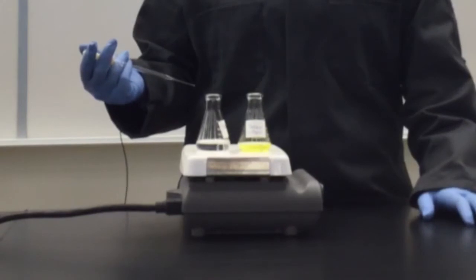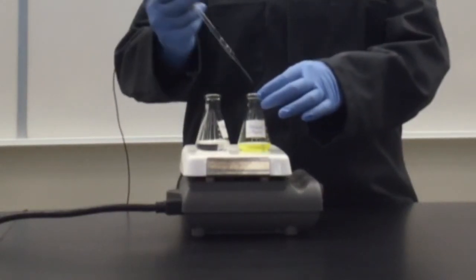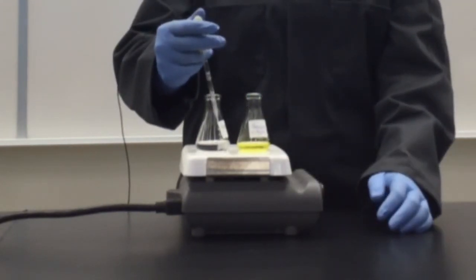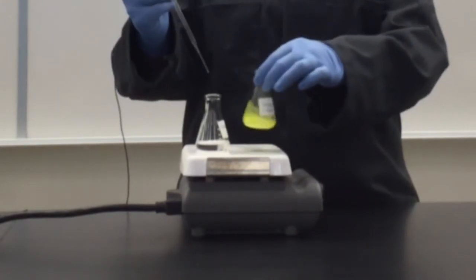So now my solvent is boiling again, so I'm going to continue adding portions of boiling solvent until I have a solution.